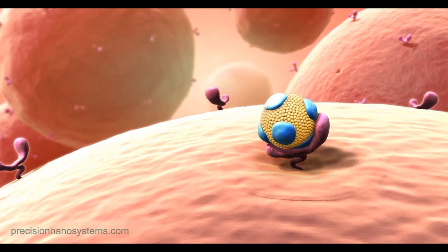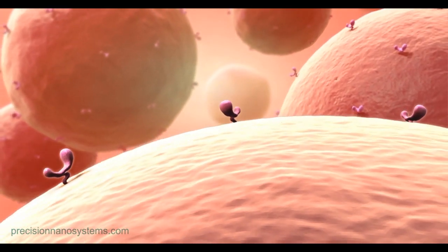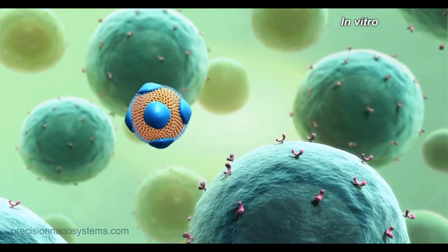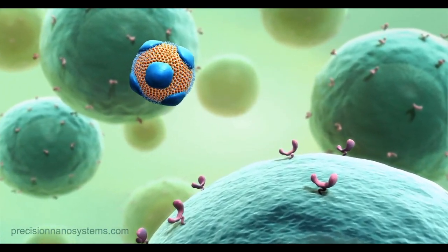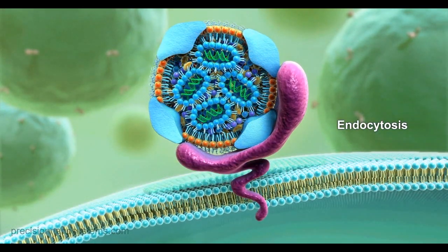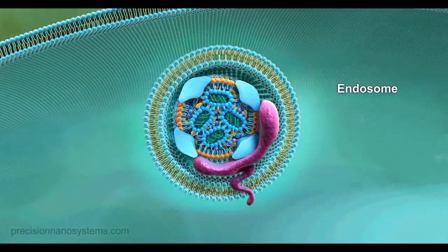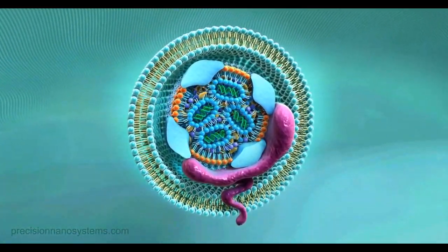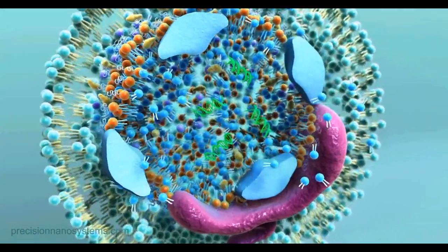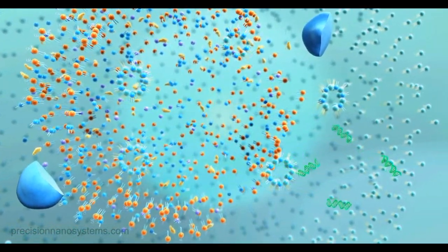Endogenously circulating ApoE facilitates uptake of the nanoparticles in vivo, while nanoparticles transfecting cells in culture may require the addition of exogenous ApoE. The lipid nanoparticle-ApoE complex is recognized by the LDL receptor. Endocytosis takes place, and the receptor-particle complex is invaginated by the cell to form an endosome. As the endosome matures, internal pH changes promote nanoparticle lipids to interact with endosomal lipids and release the nucleic acids into the cytoplasm.